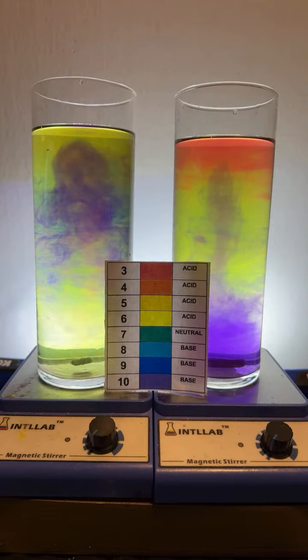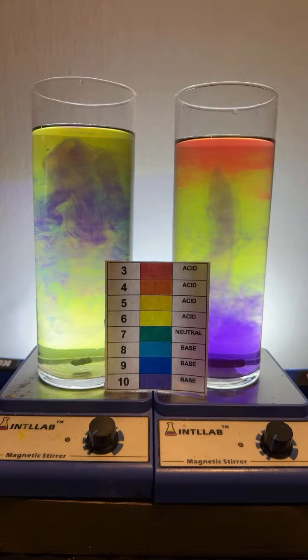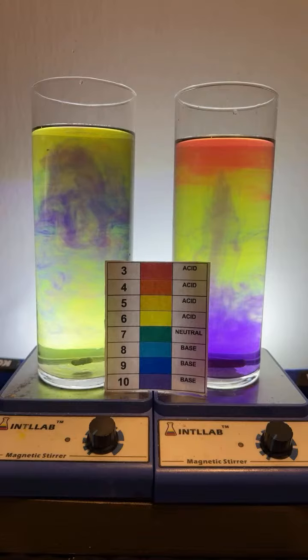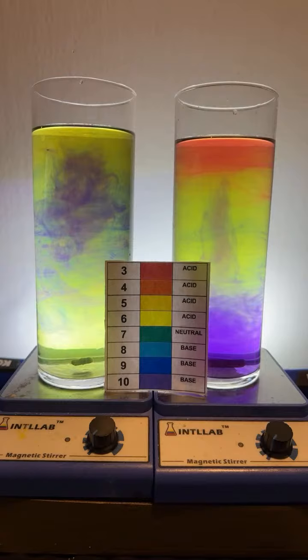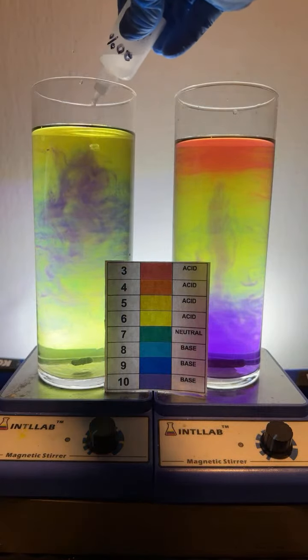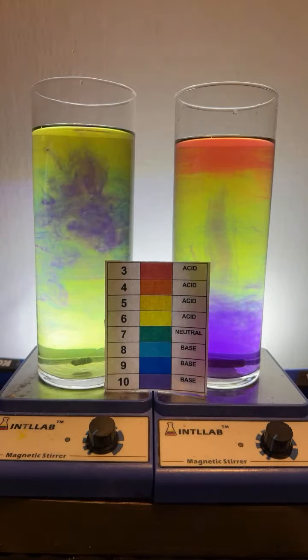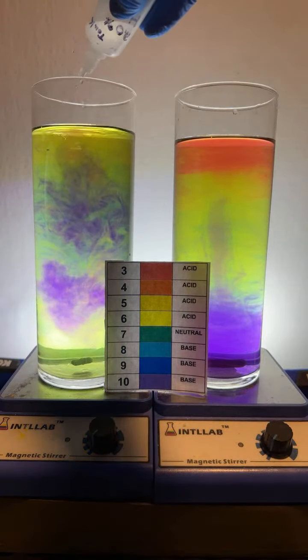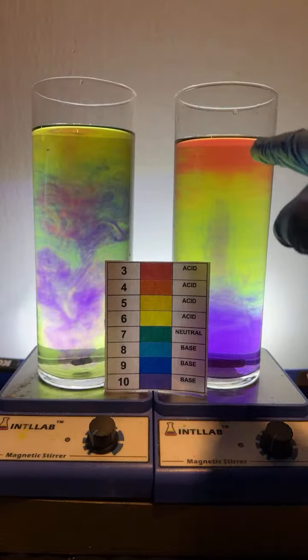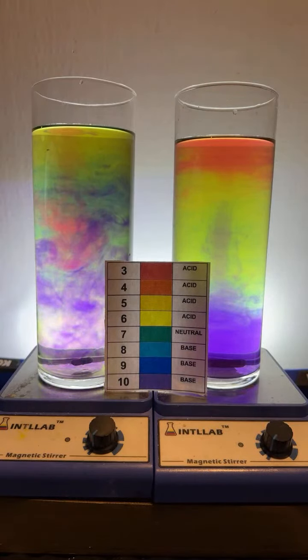Water is 7. That's correct, the ones, except any water that's exposed to the atmosphere is going to have some carbon dioxide dissolved in it. And when carbon dioxide dissolves in water, the water becomes acidic. So it's water that has the carbon dioxide purged that will be neutral. Got that pH gradient going on over here.